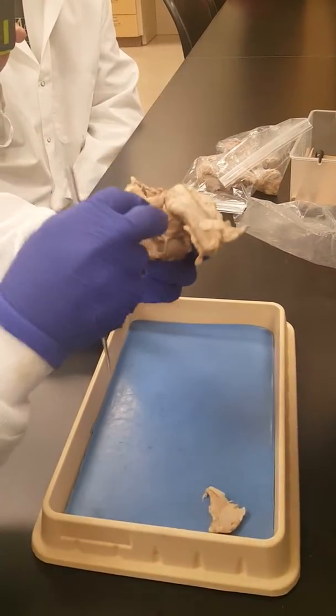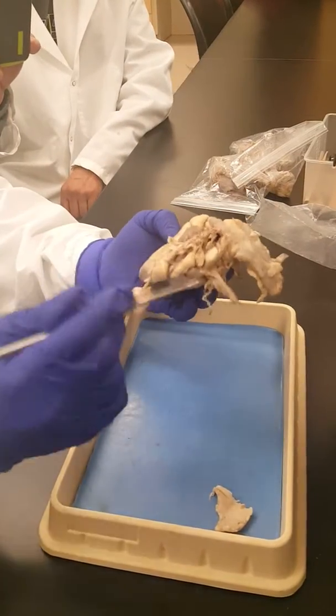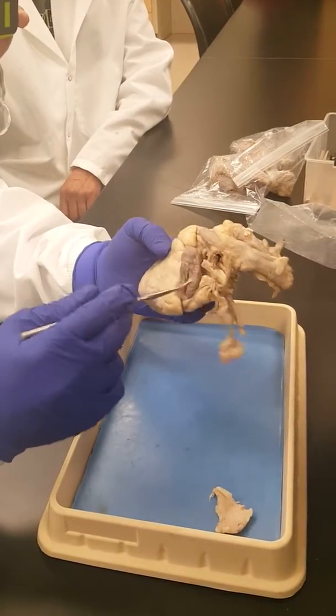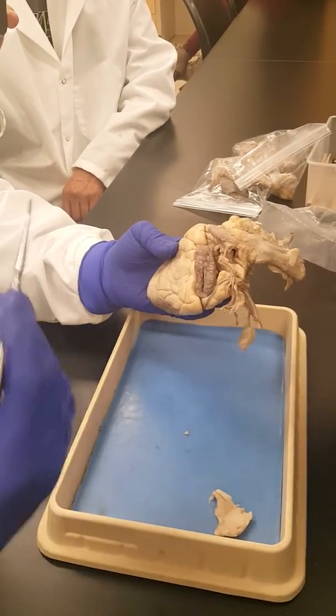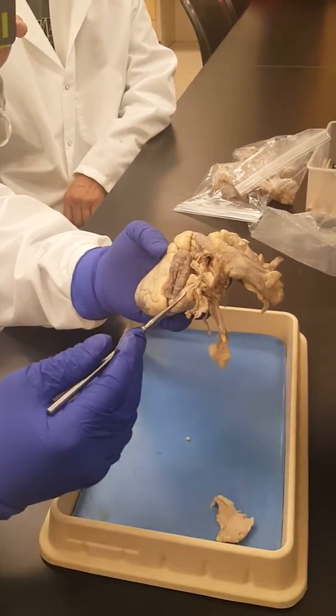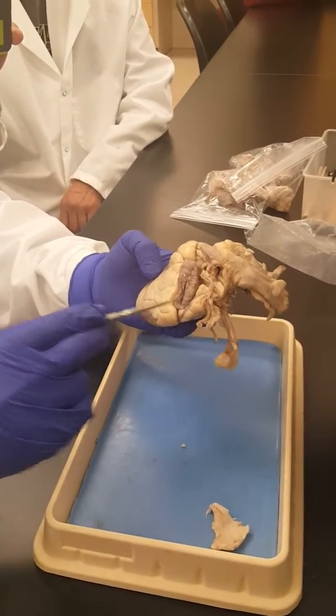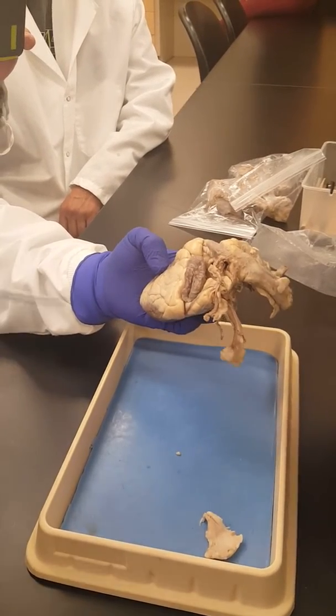If I put a pin on the left side, maybe towards the left auricle, and ask what that major blood vessel is, you just say pulmonary vein. Even though you can't really see all 4 veins coming in, if it's on the left side and I'm asking for a blood vessel, you say pulmonary vein.